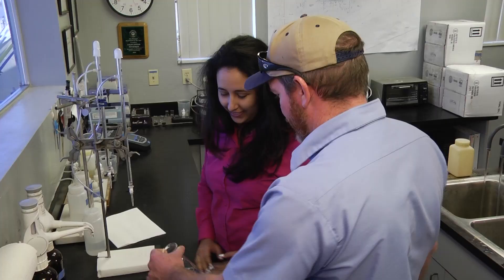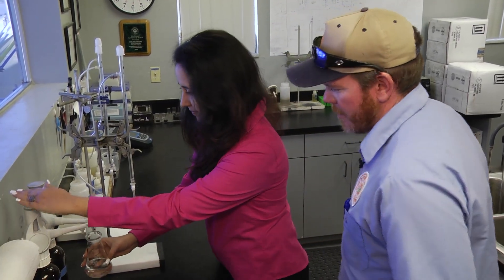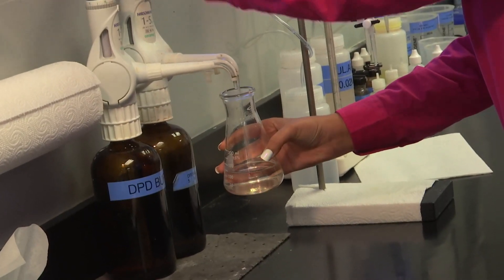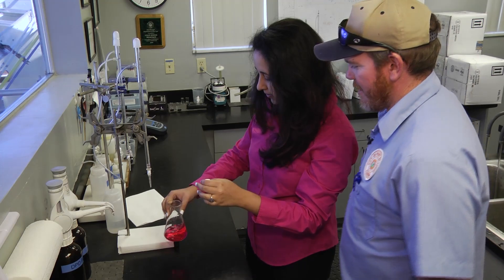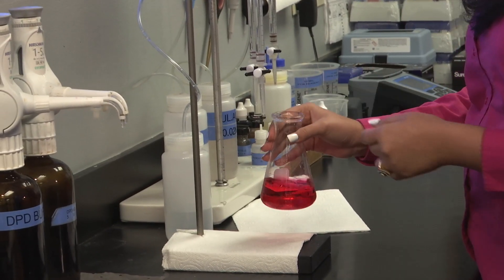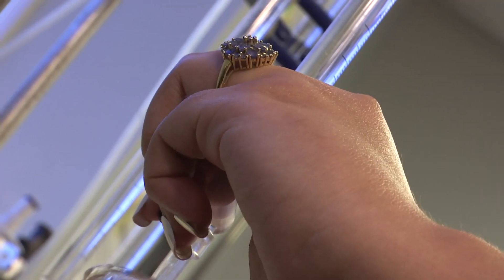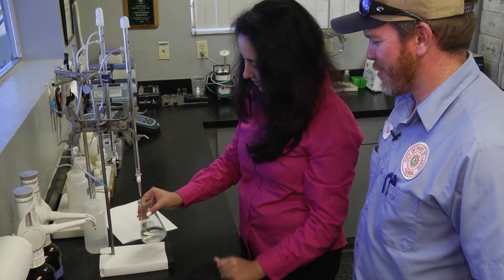Alright, Nicole, would you like to give it a try? Let's do it. Alright, so you're going to do five mils of the DPD buffer, and then we're going to add five mils of the DPD indicator. And then you got to swirl it? Yeah, give it just a little swirl. Like this? Just a swirl to your right. Yep, and then just turn that slowly and you'll feel it. I think it's just one more drop — takes a little practice. There you go. Stop there and just give it a swirl. What do you have?